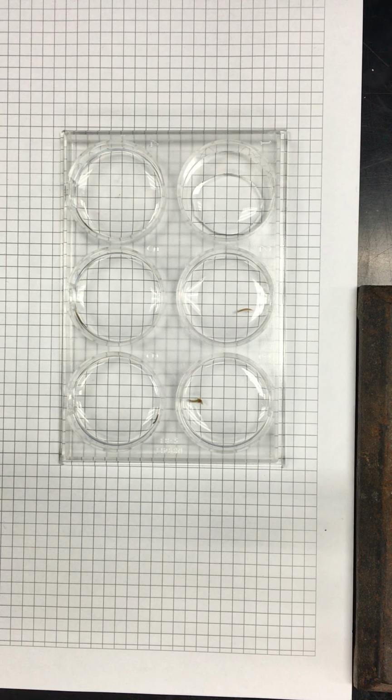You probably want at least a good 5 minutes of observation if things are happening. If things aren't happening, you may need those minutes. Yes. What's the final concentration? Oh, we want 5. Final volume is 2 milliliters.